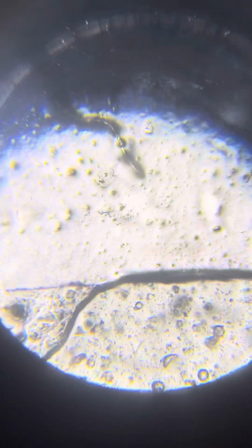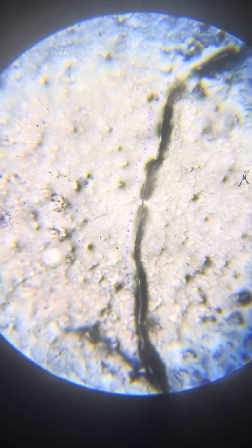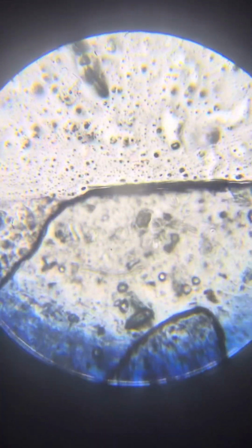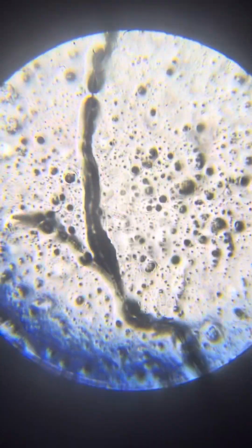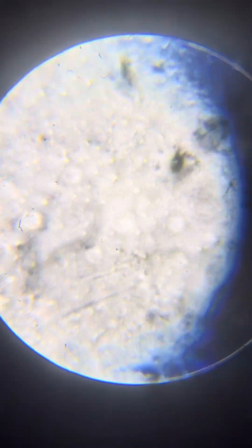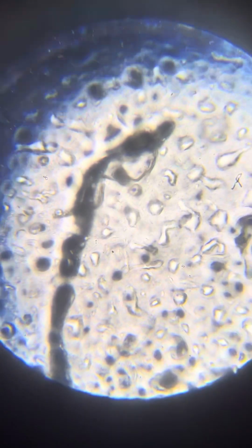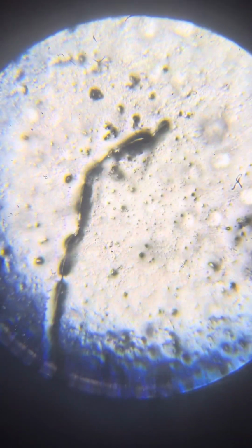Well, so this is it. Another huge one. Wow, this one. Okay, so this one is actually the largest that I've seen in this slide. Of course, I've seen much bigger ones in other slides, but yes, a very big one. Wow, very interesting. Can this guy bring humanity to its end? I don't know, but let's find out.